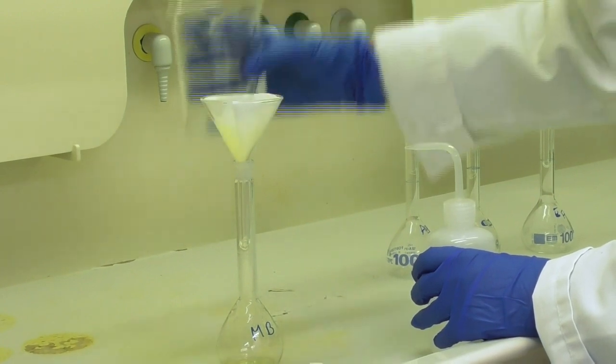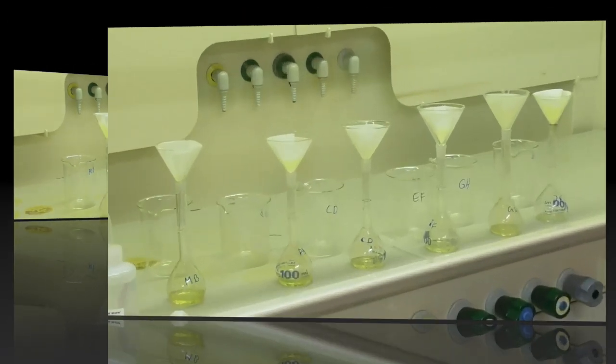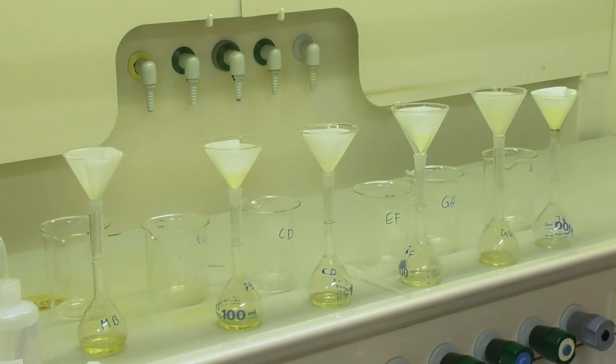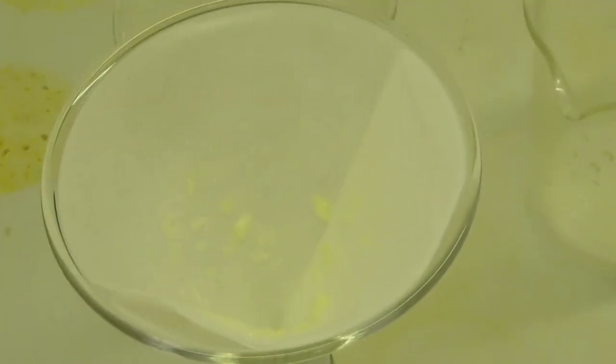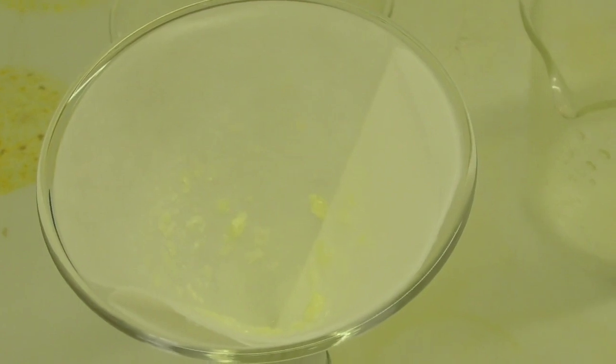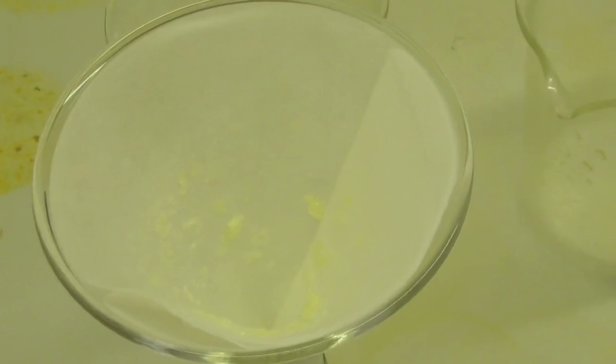And then I let it run through, so all the samples will be sitting there filtering. What is left behind is some yellow goo in my filter paper.